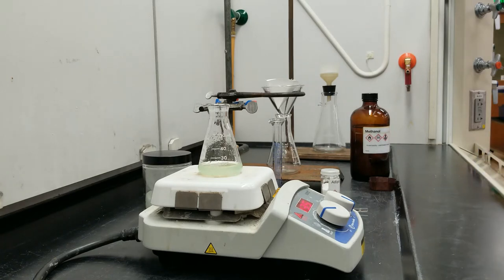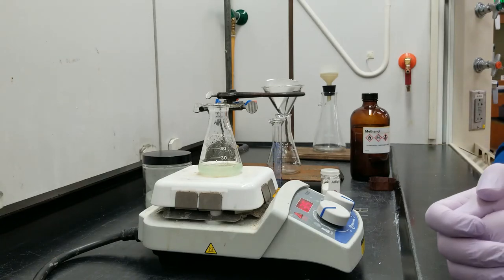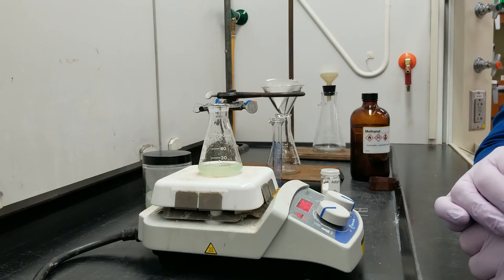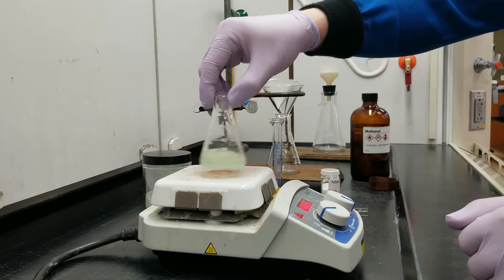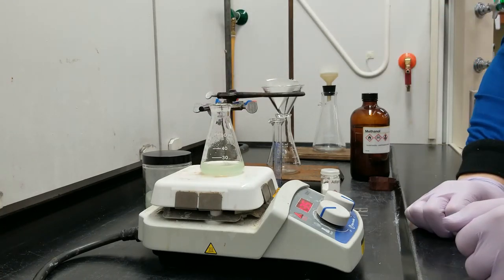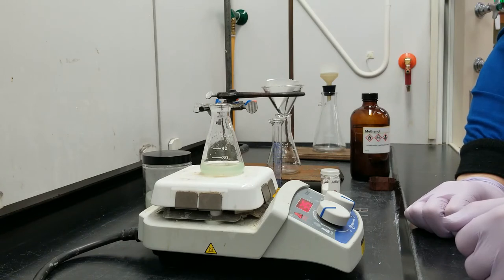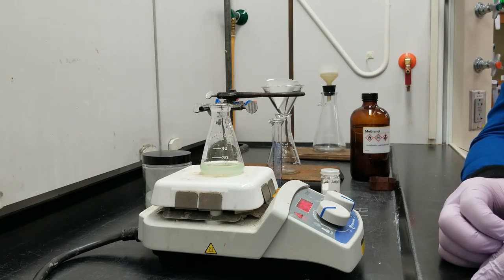Let me check the camera. Maybe you guys are able to see that but I am seeing these drops running down the side of the flask. So I'm at a comfortable reflux here and I'm going to let it heat just for a second just to make sure that we're absolutely as hot as we can be.